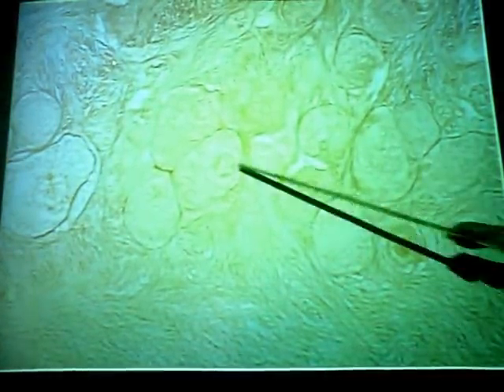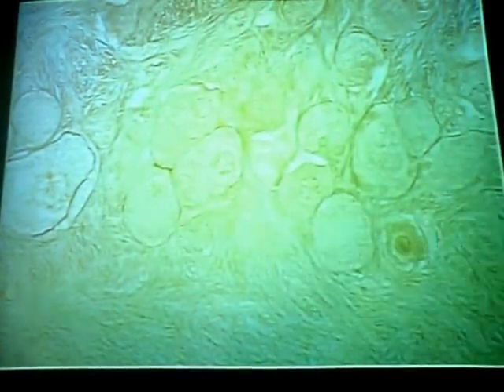So let's look at the different follicles and differentiate. First, those follicles which are more toward the outside, more toward the edge of the cortex, and very numerous, but very small compared to the others, are these. These are primordial follicles.